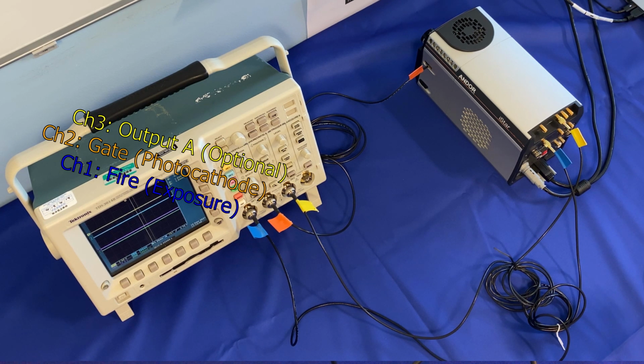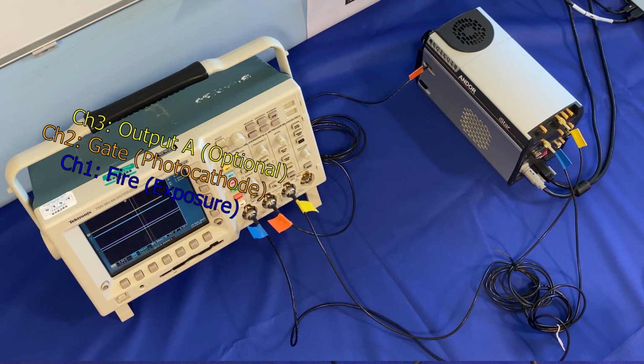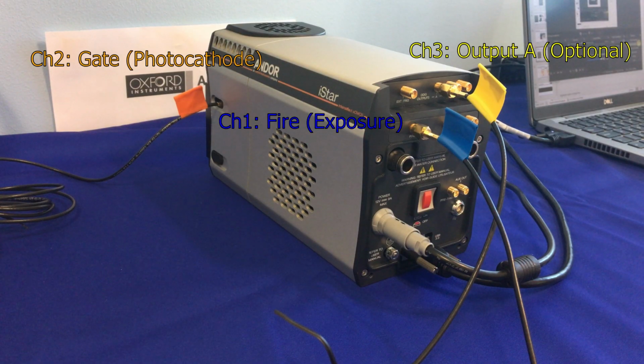And thirdly, we have in yellow, we've got our camera hooked up to output A, and so this is a signal that, as mentioned before, you could use to trigger some kind of third-party laser or instrument or stage, depending on what experiment you're doing. And we've put that on here for demonstrative purposes.